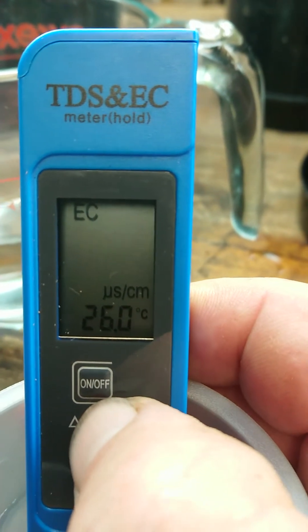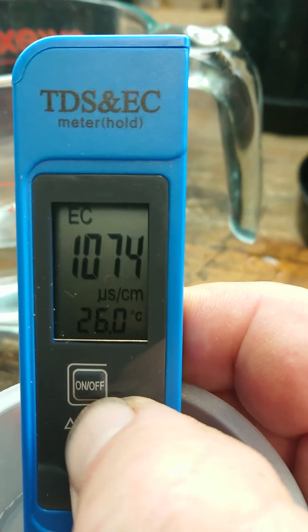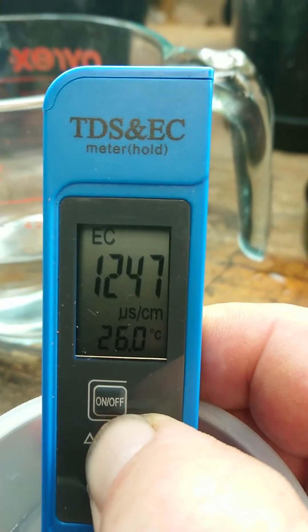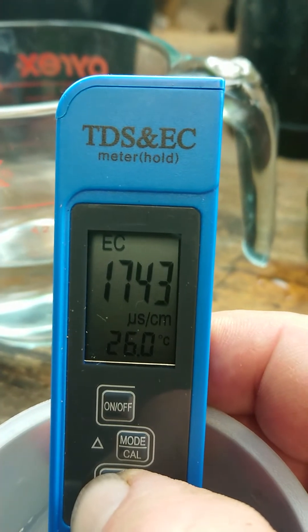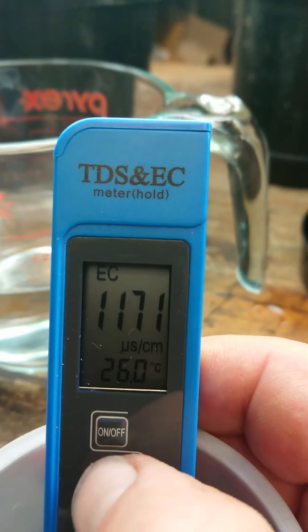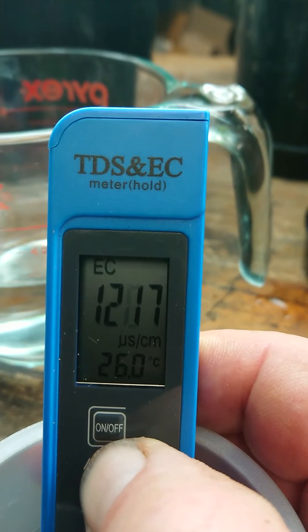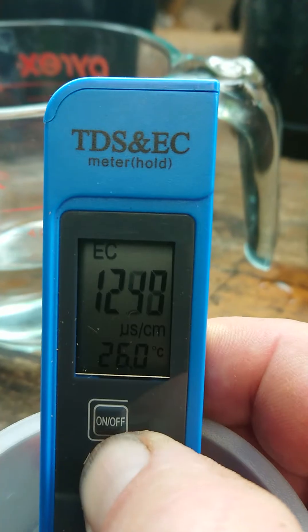The reading is now flashing. We can go up one at a time, or press and hold the button and it will go up continuously. When you get close — it's gone over 1413 — so now press the down arrow button to start going back down.